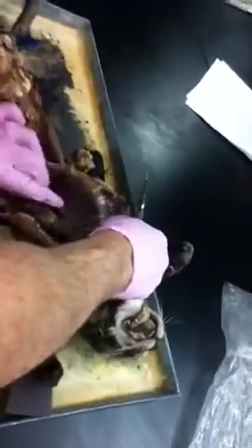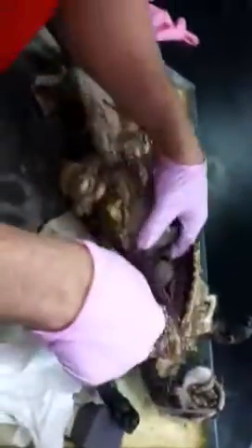The other one that's pretty easy is that azygos. Where do you see that azygos? If we go on the right side and do a lung scoop, you see your azygos sitting right here. It's only on the right side? Correct, yes. And the purpose of it is if the inferior vena cava trashes out for some reason, the azygos takes over. Oh, cool.